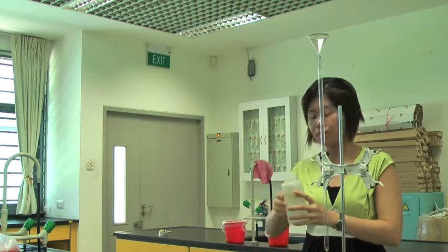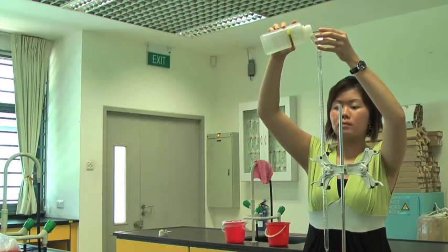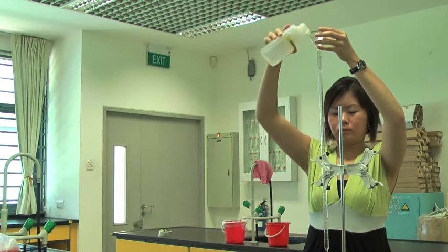Next, wash the burette with distilled water in exactly the same way as described earlier.